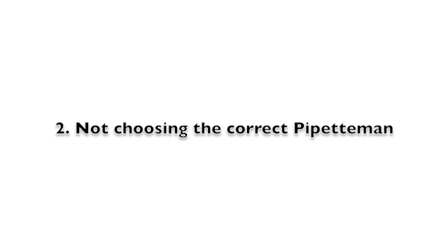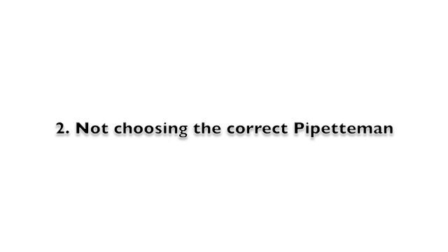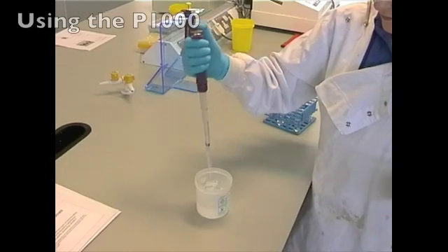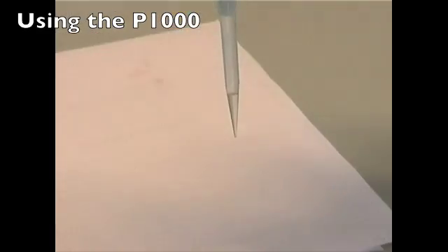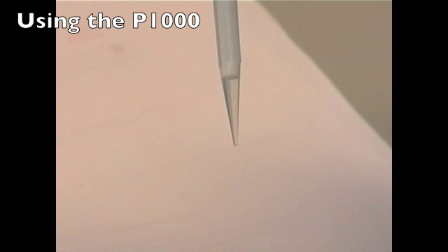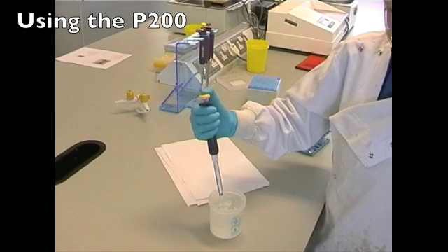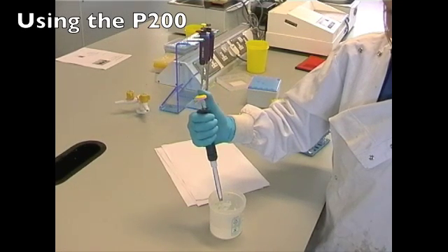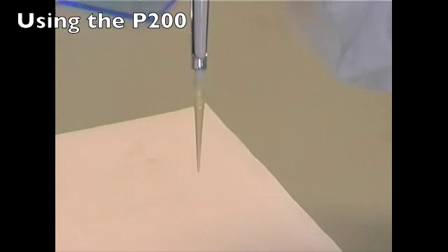Not using the correct pipetman is an easy error to make when you first start. Using the example of 200 microliters, using the P1000 to measure this amount is incorrect. The pipette tip should be as full as possible, as this will reduce the chance of error. If the P1000 tip is less than one-fifth full, you should be using the P200. Remember the range of the three pipetmen and you should have no trouble choosing the correct pipette.